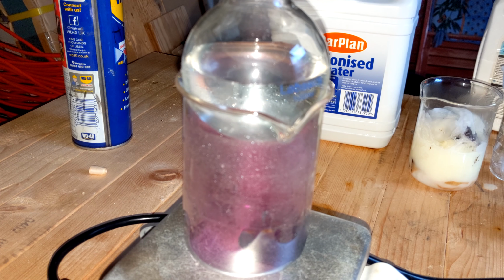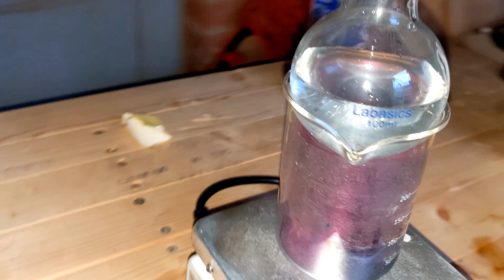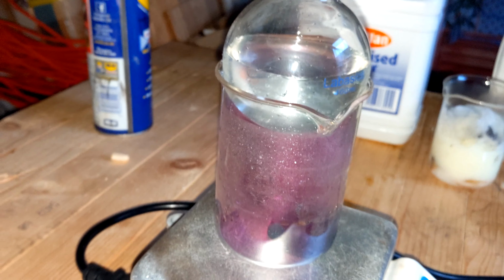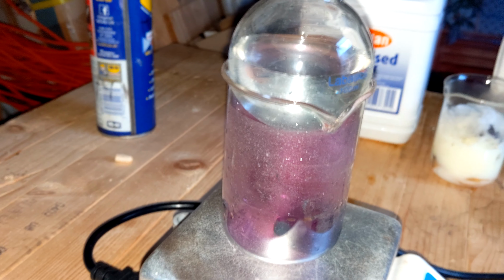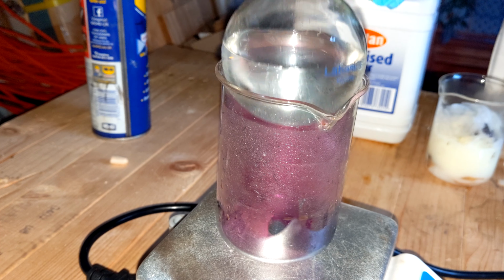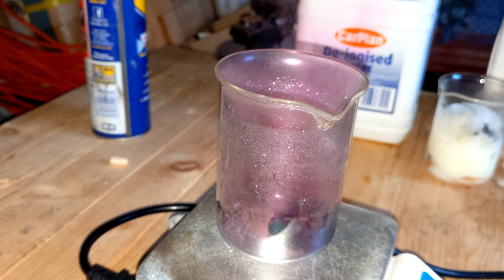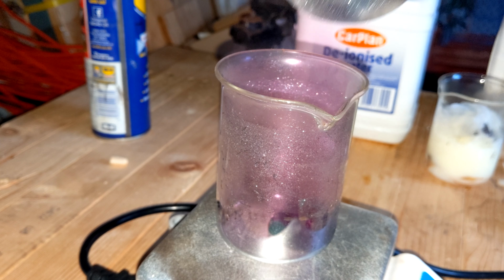It started to get dark very quickly, so I had to use a torch to light this up, but you can see what's going on. You might be able to see the fumes in there really starting to get quite thick. And you can see the fumes billowing out if I take the flask off, and the iodine crystals beginning to form.